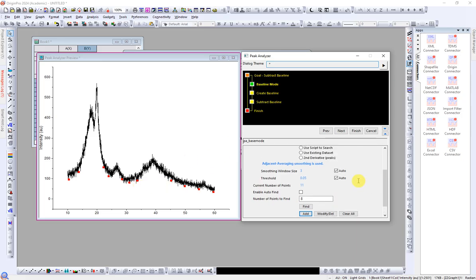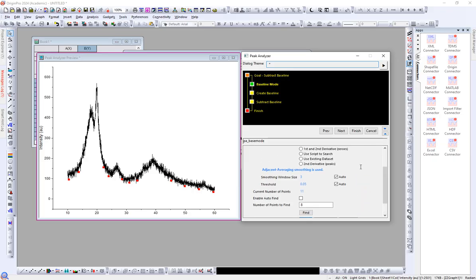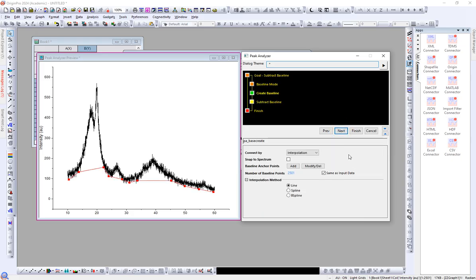So now we have to go to the next step. There are no other options, so we will go to the next step. Okay, now you can see these are straight lines. If there are straight lines, they will subtract the baseline, but not very well. So you have to choose the spline. It will look like this. And B-spline, it will be like this. So this is the direct line. I will choose the BSpline. You can choose according to your data, whichever fits very well.